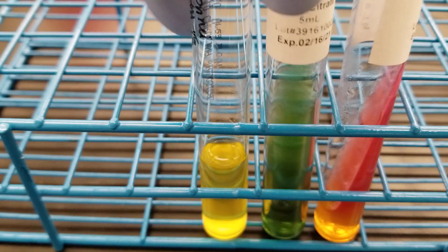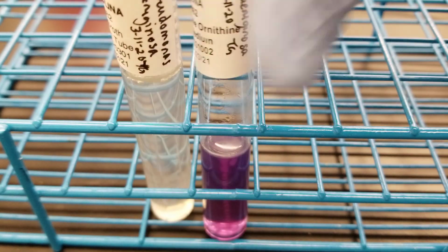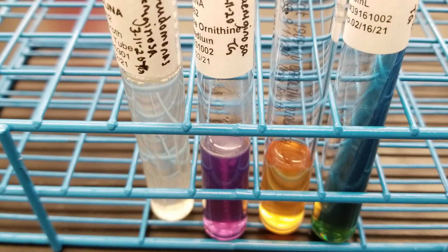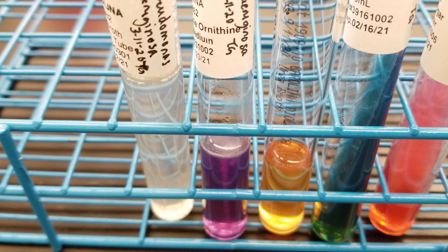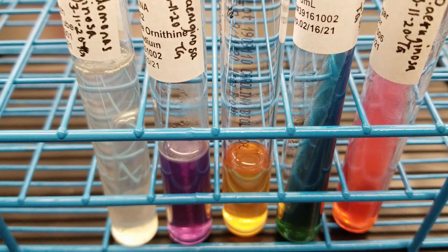It's our non-lactose fermenter, or non-fermenter also. Pseudomonas aeruginosa is not in the Enterobacteriaceae family. And this is the only GNR in this grouping that we use to indicate non-lactose fermenters, that group. But Pseudomonas aeruginosa is a big baddie in the clinical setting, causes a lot of problems, and you'll always see it in the news, especially with cystic fibrosis patients.